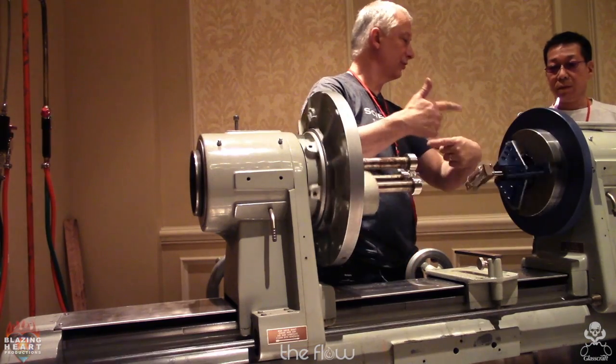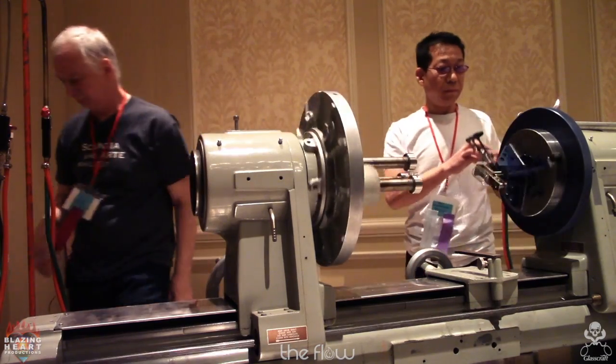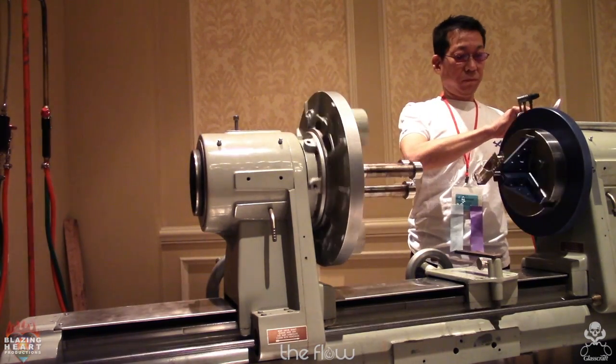Question, this is turning this way. Is that okay, or do you want it the other way? Japanese style is towards you, okay. Apparently they do it the right way.